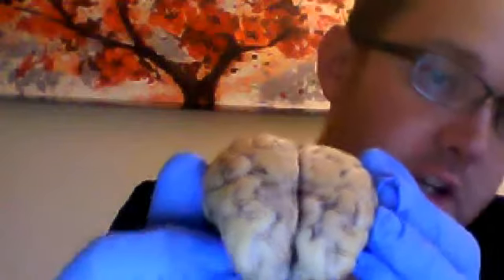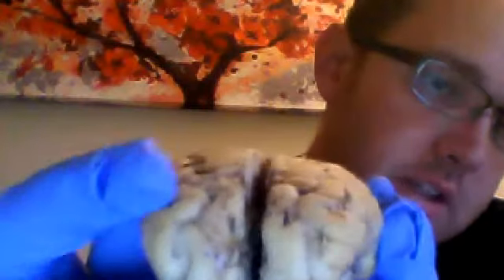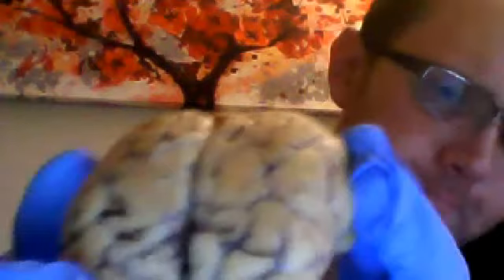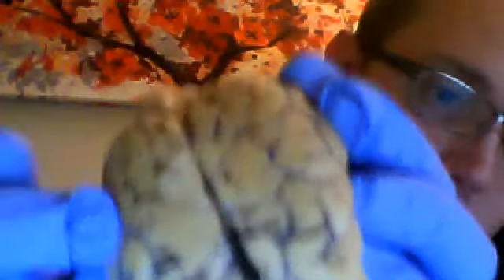In order to describe a little bit more about the difference between a sulcus and a gyrus, when you look at the brain, you have certain areas of indentation, and those you'll see on the video. They're kind of the shadowy areas, right? See, along the area. Let me see if I can get closer. Right there and along there.